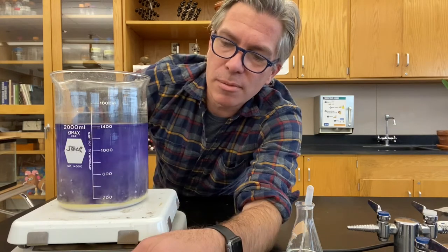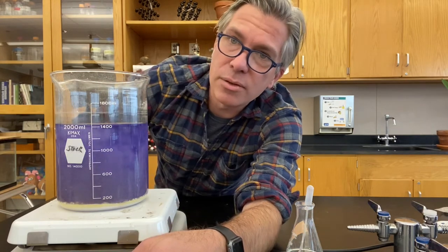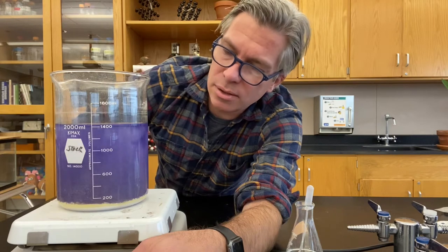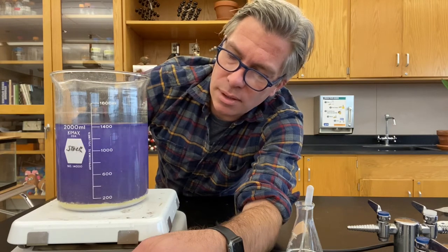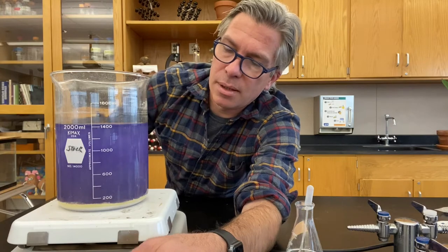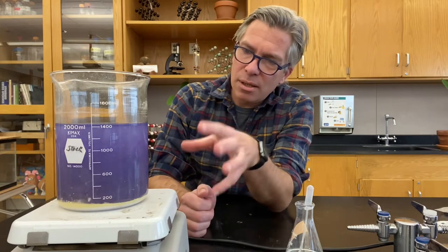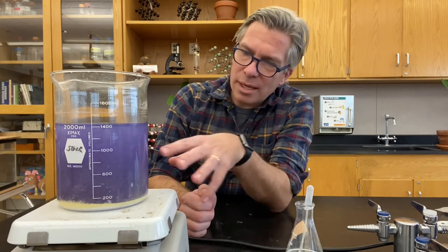I'm going to set up the stir bar and you'll see it start to disturb the solid at the bottom of the beaker. As it's stirring you'll see some of the chunks getting pulled up into the vortex and the water layer.